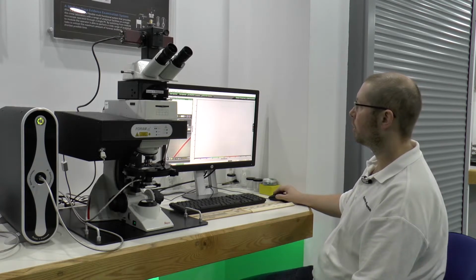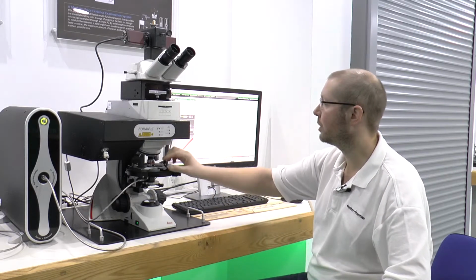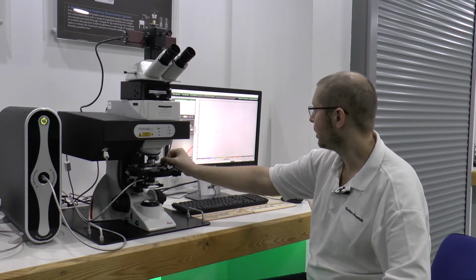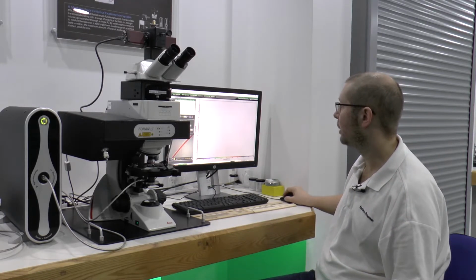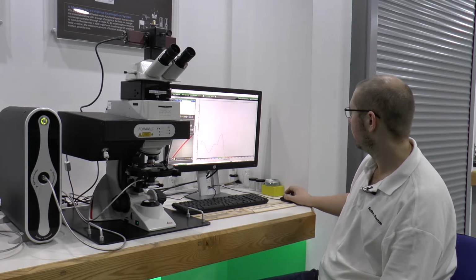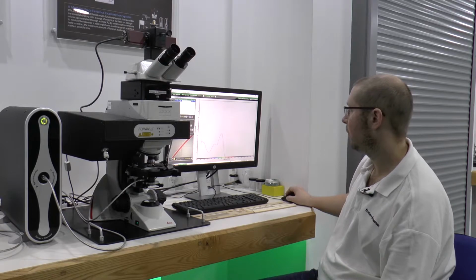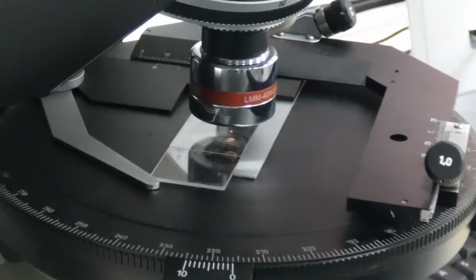And now we need to record a dark reference. Once the white reference and dark reference has completed, we just now need to position our fibre under the crosshairs, as indicated on the live video feed. Make sure that the fibre is in focus, and we can record our spectrum. It will use the same parameters that it took from the white reference to then record the absorption spectra of our red fibre.